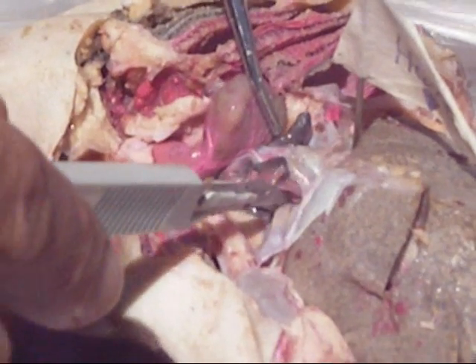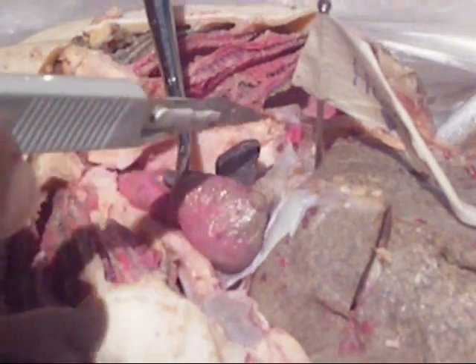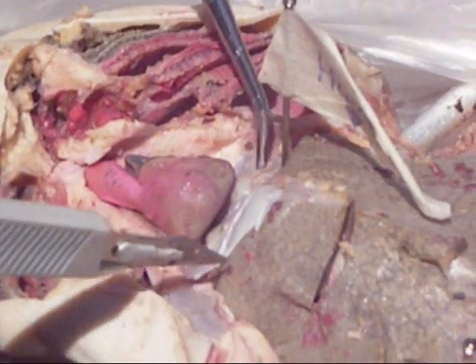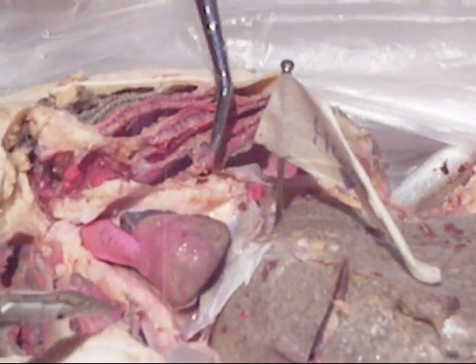I just think that's the other chamber. Well, it's not the other chamber anymore. Is that white film the equivalent of the diaphragm? No. This is just the cardiac sac around the heart.